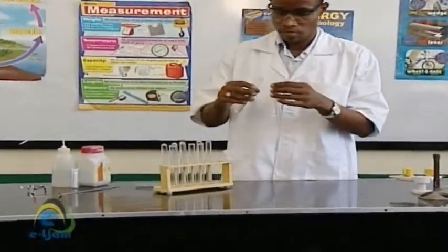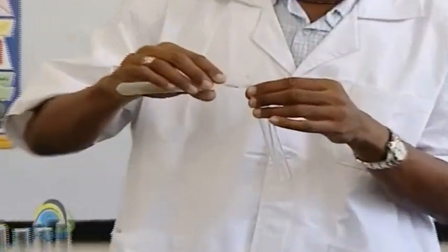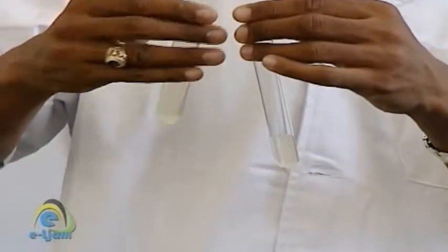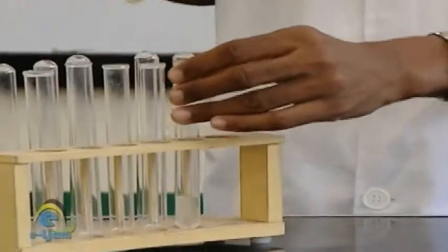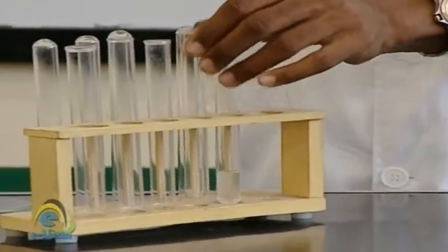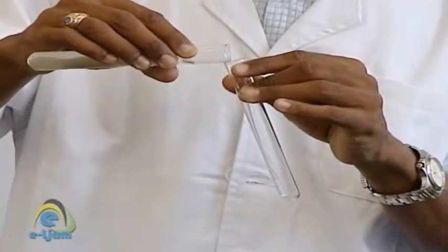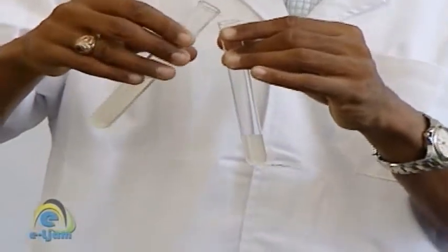Dissolve the remainder of Y in 10 cm³ of distilled water and divide the solution into four equal parts. Observation: light green solution formed. Inference: possibly iron(II) salt present.